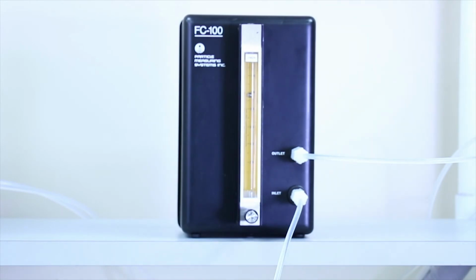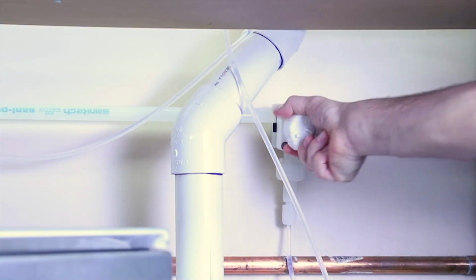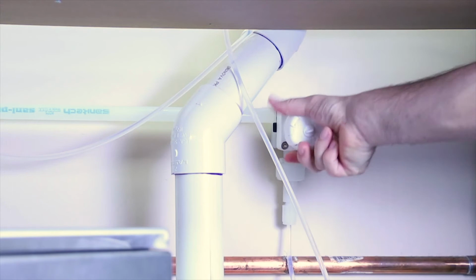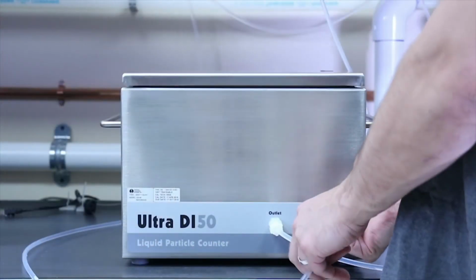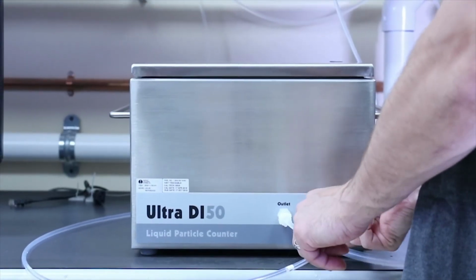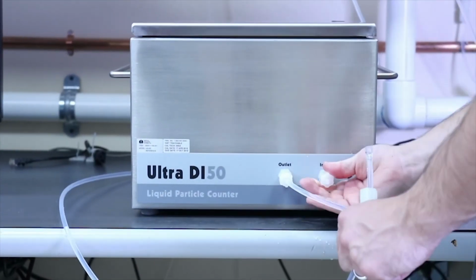Now we will return the UDI 50 to the correct connection configuration. Start by turning off the flow of the UDI 50. Disconnect the inlet and outlet lines and install them to the standard configuration with the inlet line going to the inlet port on the instrument and the outlet line to the outlet port.